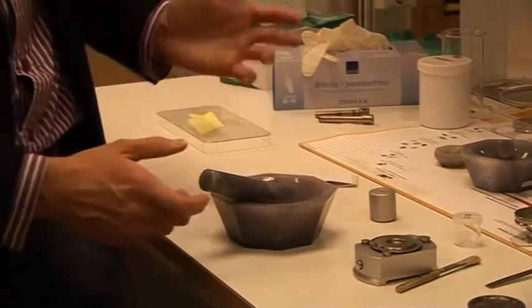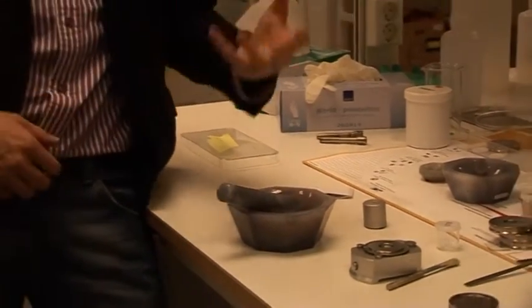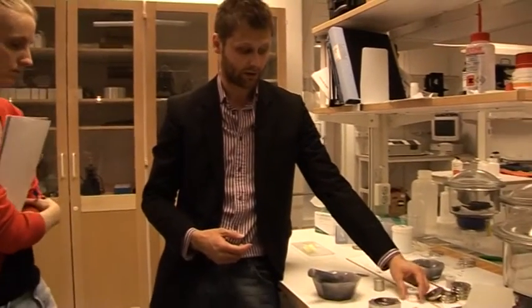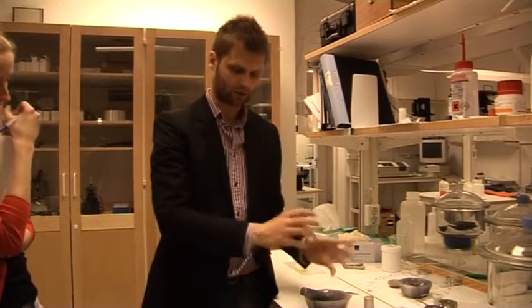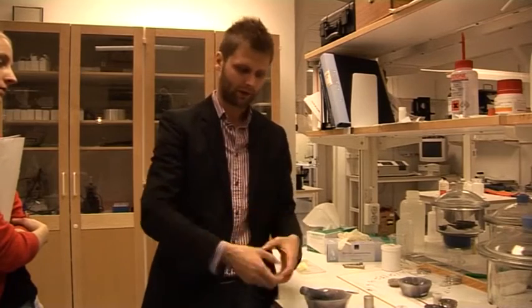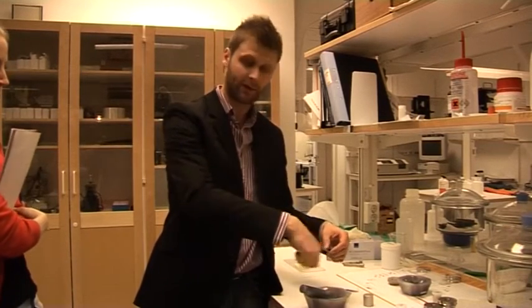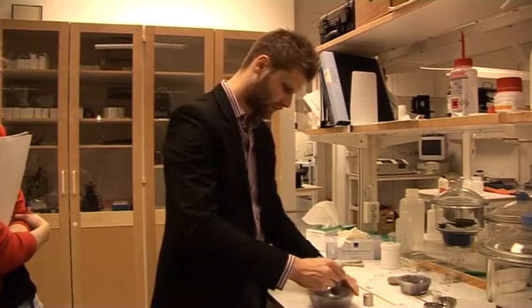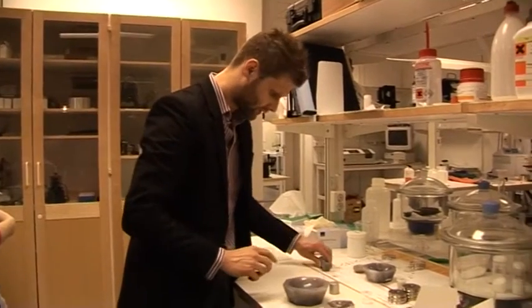Quite homogeneous. When you prepare a bit more complicated samples, like if you take a sample from a field experiment with rocks or something, usually people collect a sample from the soil. It is usually a combination of many compounds and substances. You have to make sure that you have it well mixed, so the sample is representative. Try to first make it well mixed and that you have all the parts when you grind it also.